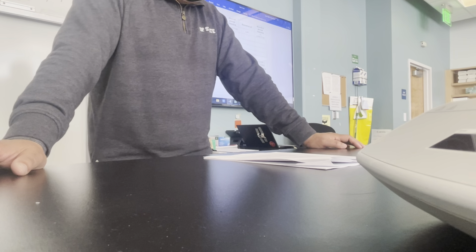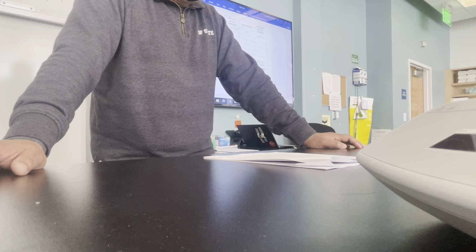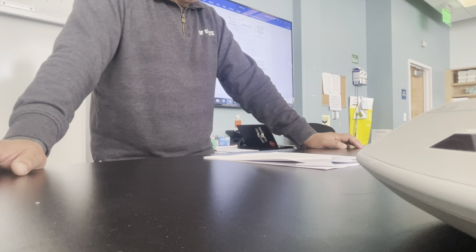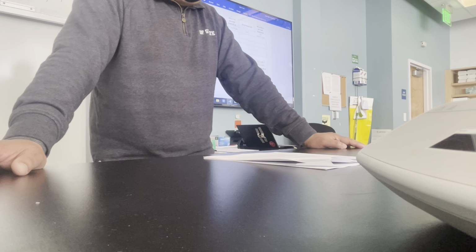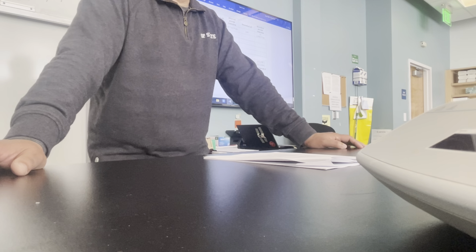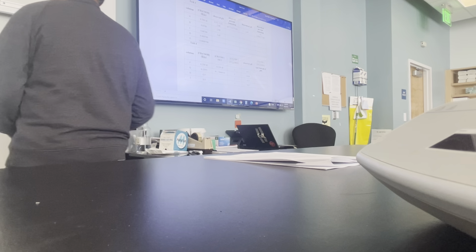So what did we do? We took 10 ml of glacial acetic acid, which is 17.5 molar in concentration, and then we diluted it to 250 ml with water.